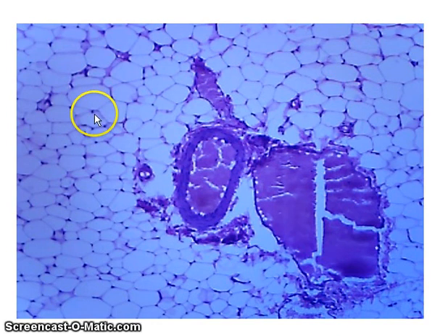And if you look at the outline of these cells, you can see some dark structures here. These dark structures are the nuclei of the adipocyte, and as this fat vacuole fills up with fluid, the nucleus will get pretty much pushed to the outside of the cell, and so that's why all these nuclei are right there pressed up against the cell membrane.